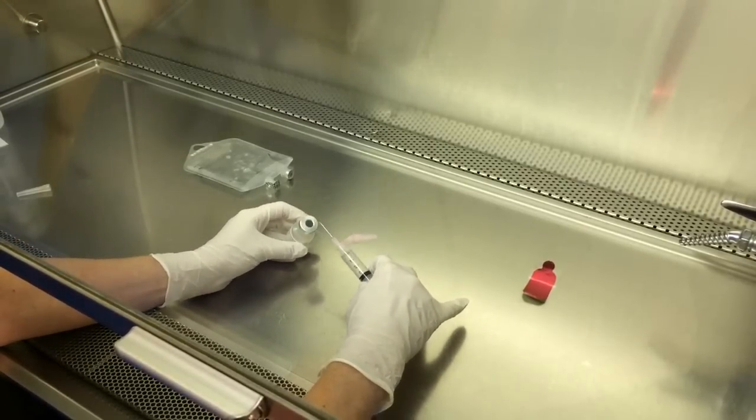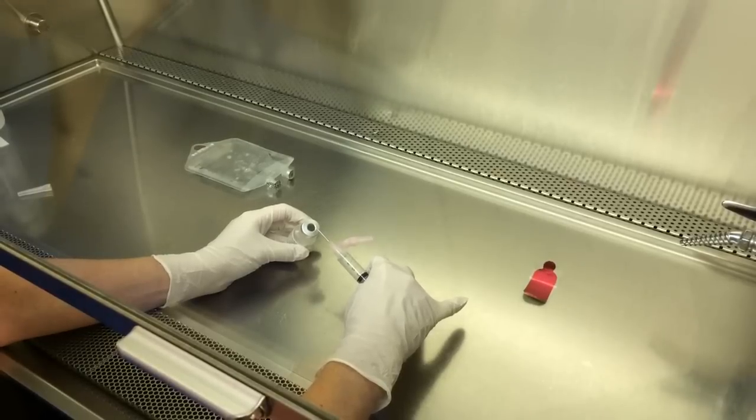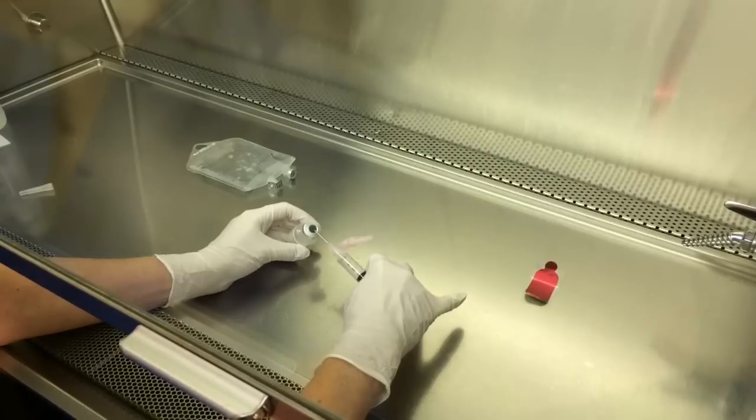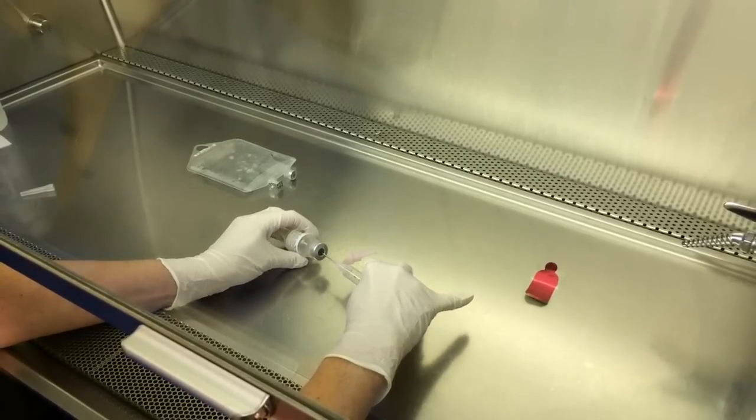To get the volume out of your vial, depending on the type of medication, you want to make sure you keep the pressure equal inside the vial.